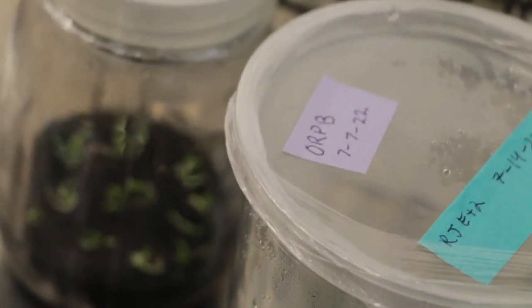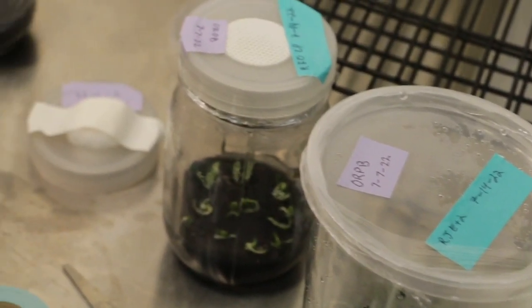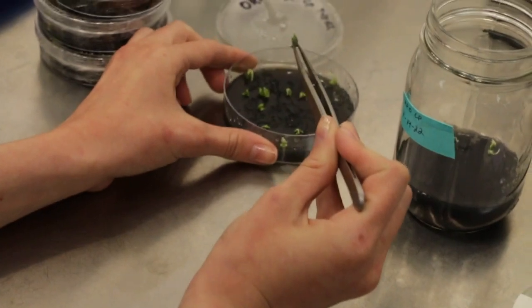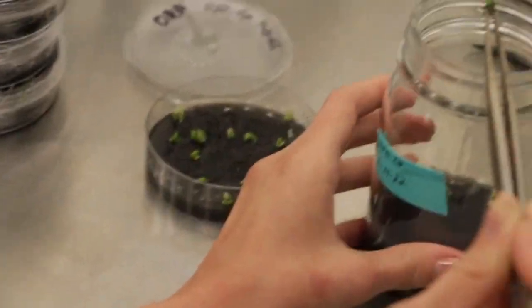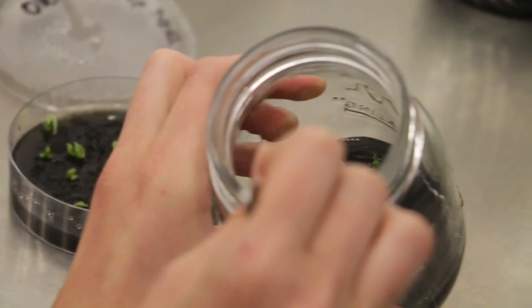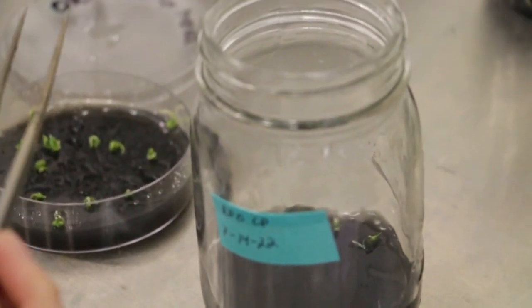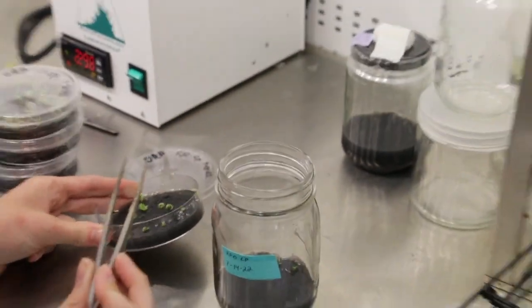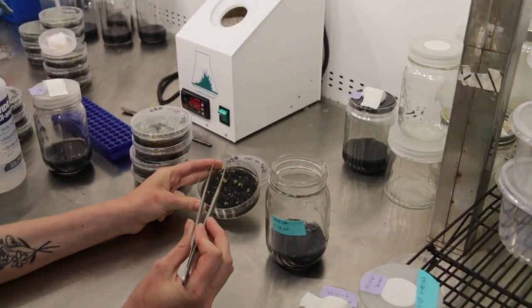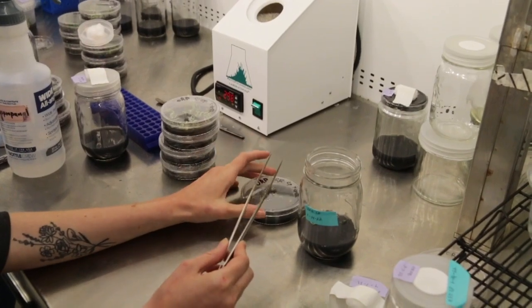We have different types of containers that we're evaluating. This one doesn't have any ventilation in it — it's just a tub. But these are just different containers. What's going on is she's transferring the larger seedlings of this orchid from the petri dish into the bottle shown right here. That kind of gives you an idea of what's going on. Let's get behind somebody else and see what other transfers are going on in the hood.